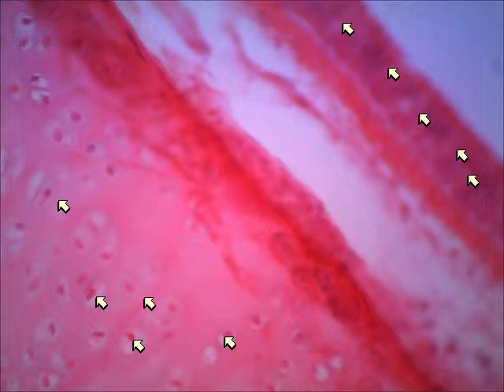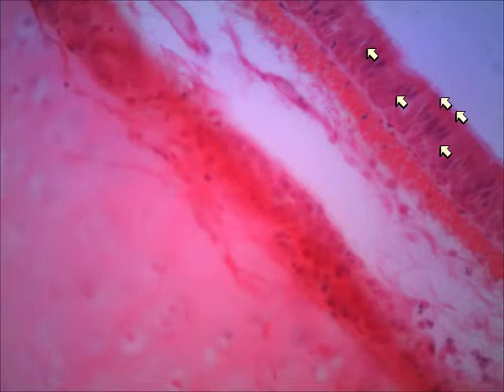So then what I did was take my fine adjustment knob and focus a little bit more, and now it was like this one. You can see that the epithelium is much more obvious. You can even see the cilia. See the little cilia right there? Okay. This is that pseudostratified columnar epithelium, but on the bottom left where the cartilage is, it's not in focus. So I'm going to go back to the slide just before this one.